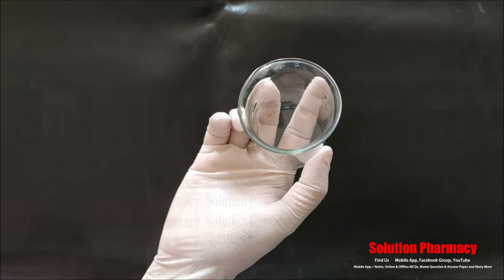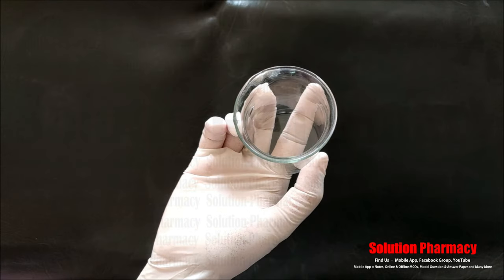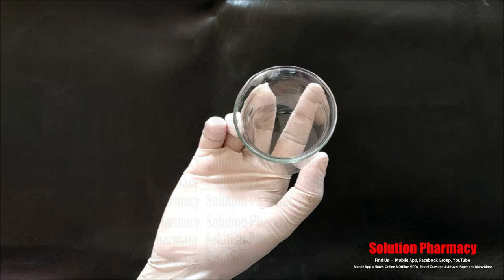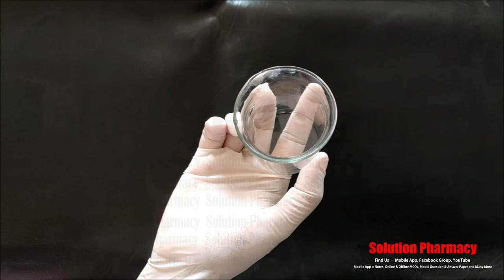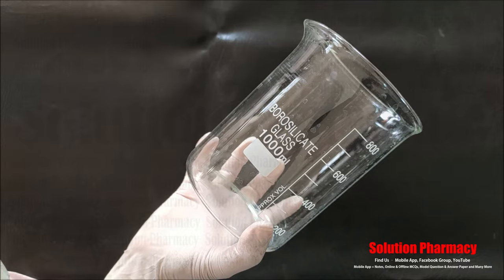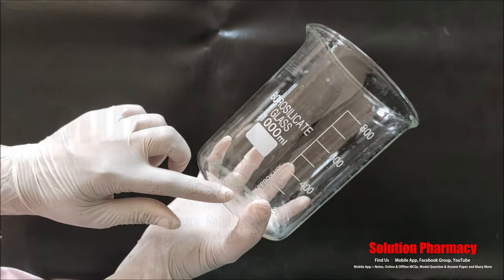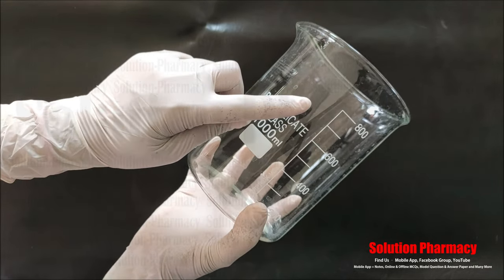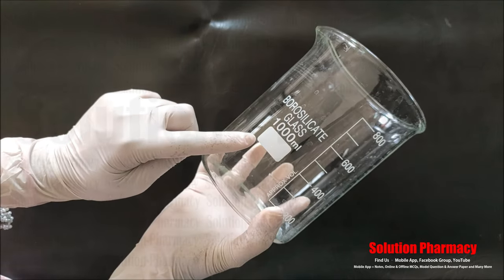If we use a soda lime glass beaker for high temperature, heat, or to boil liquid, this beaker will break. Next you can see here, this is a 1000 ml beaker, also made of borosilicate glass. It has graduation for approximate volume measurement and you can see it is cylindrical with a spout for pouring liquid.